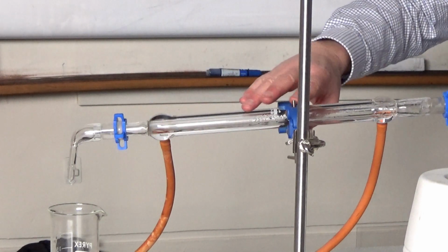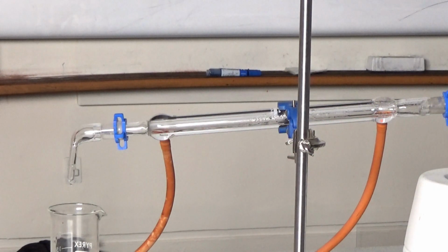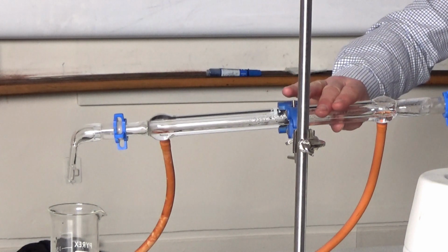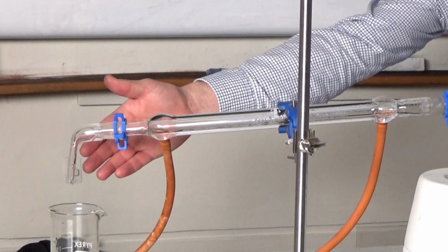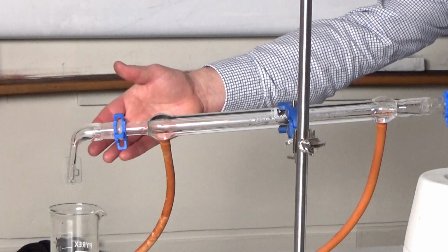The condenser is kept cold by having water continuously flowing in this tube here. It flows around the jacket of the condenser and then out and back down the sink. So as the vapour comes down the condenser, it will hit the cold tube and condense. And we can see all those droplets of condensation are forming, and we're now getting the solvent over here. In this case, it's the water from the copper sulfate solution.